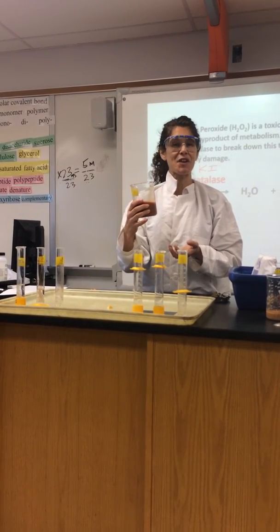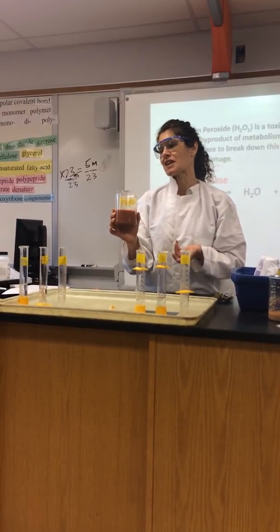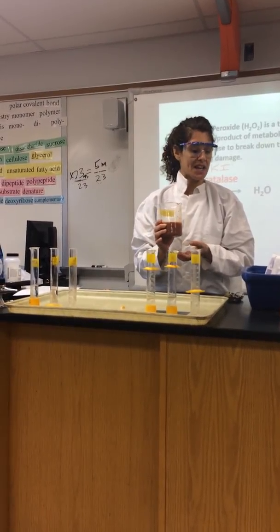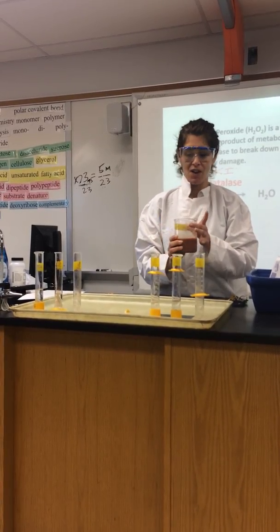This is not human liver. It is actually chicken liver, which you can get at the grocery store because some people eat it, and it's very cheap because not many people eat it.